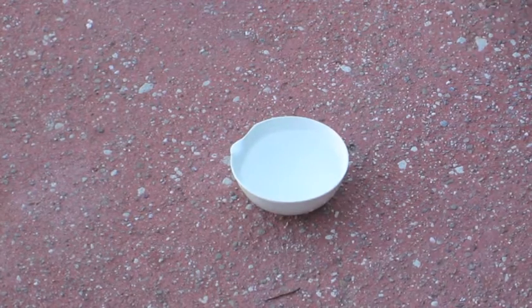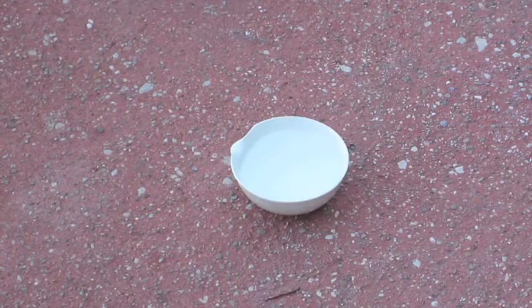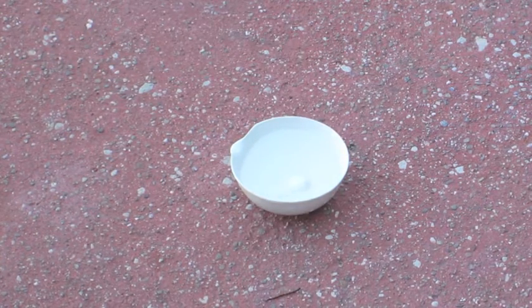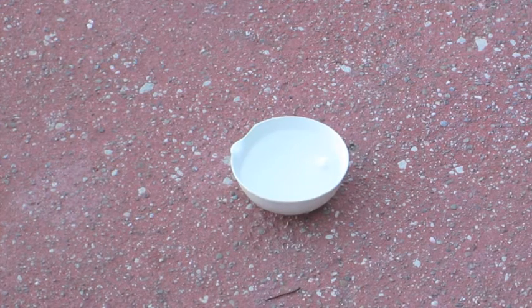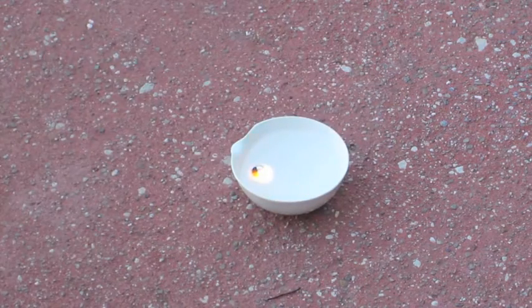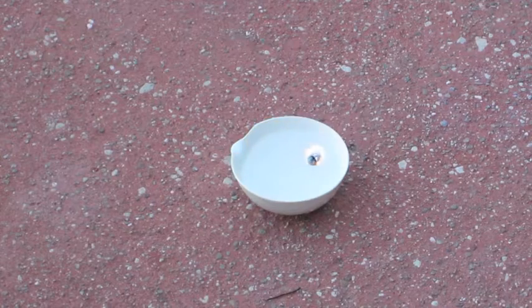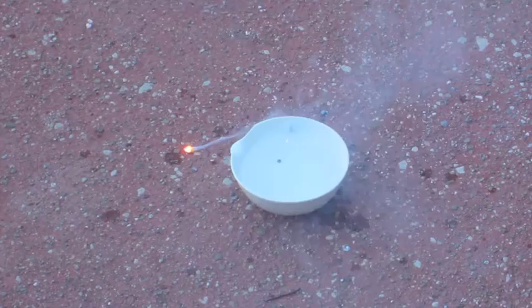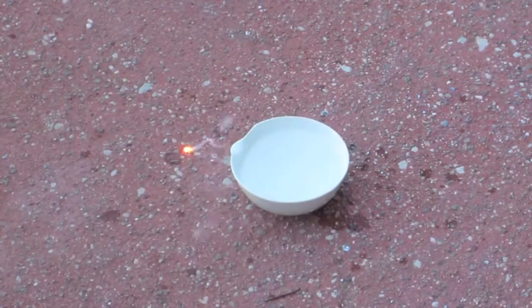Okay, here we have, I'm going to put in what is going to be the weakest or most reactive metal in not even an acid, but in water. And we'll see if it reacts. There, it's definitely reacting, and that's some sodium metal. And so, because if you think of this as a contest, sodium is definitely in last place. That is quite spectacular.